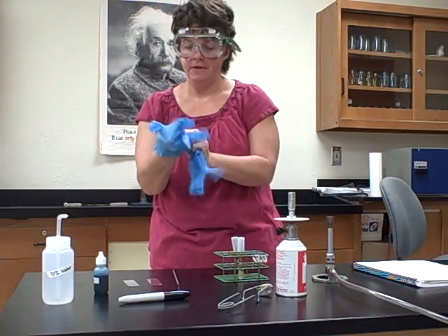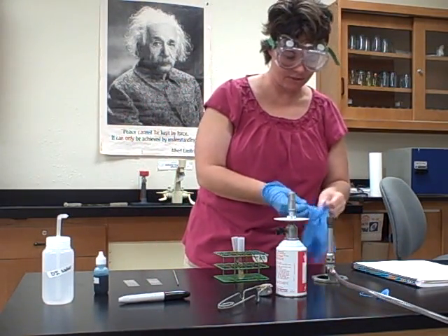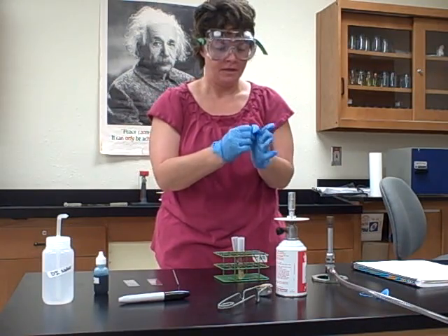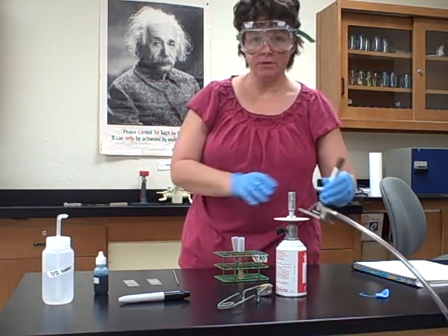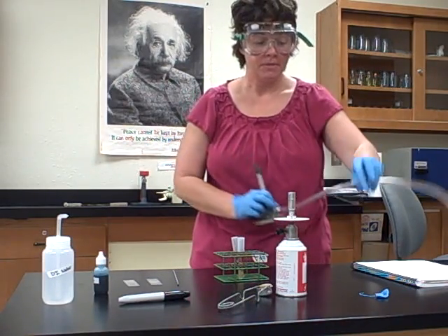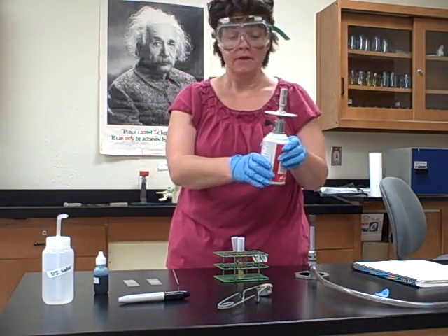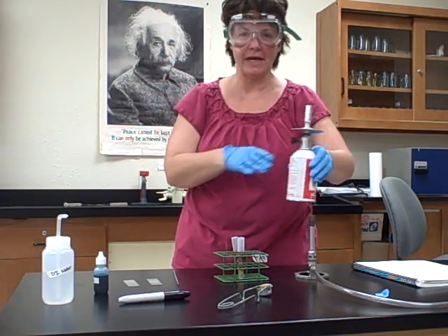I ripped my glove — maybe I should have done that first. Well, this is our first video so you're going to see all my mistakes. Now, normally we're going to use Bunsen burners hooked up to the gas line, but the gas is currently off and we're in a classroom without gas, so I'm going to show you how to do it on our little temporary gas tanks until the gas is turned on.